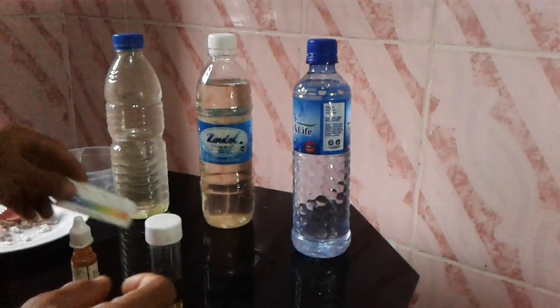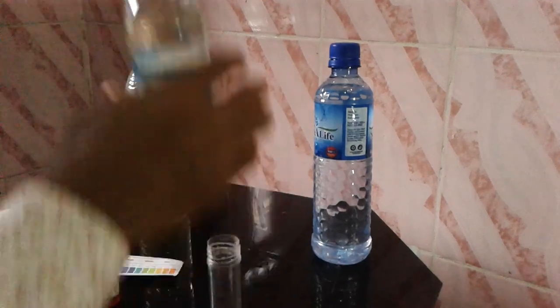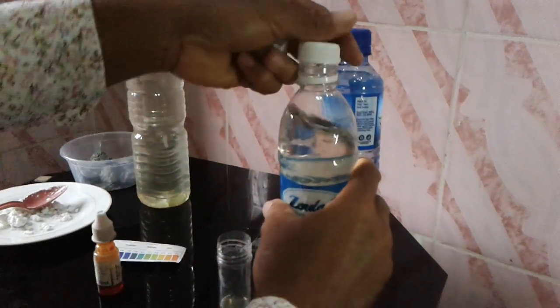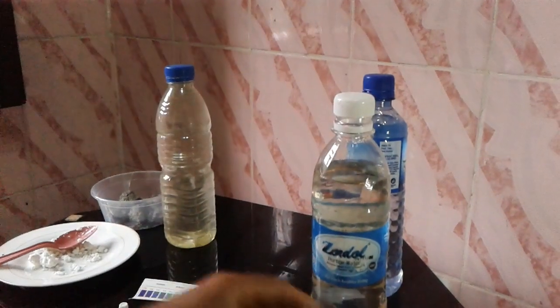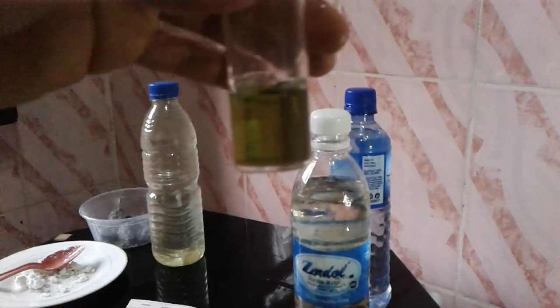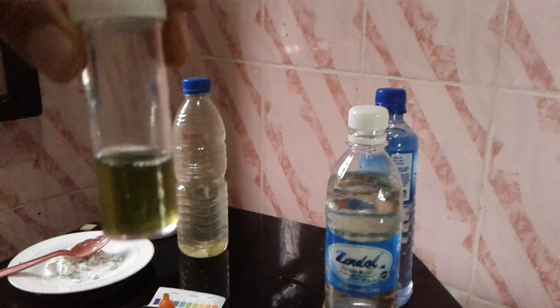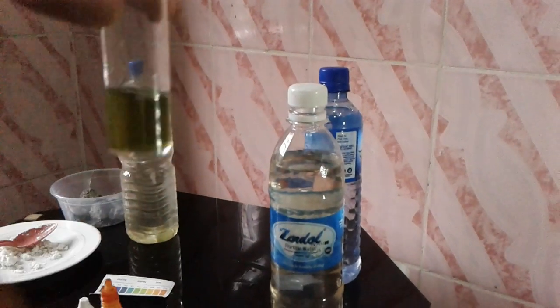Now the pond that is currently undergoing treatment at my farm — I'm going to test that water sample too. I'll drop three to four drops of the pH tester into it. You can see this is exactly pH 7, which is very, very good for your fish. As I speak, the water is undergoing treatment because of the renovation work I did on that pond.